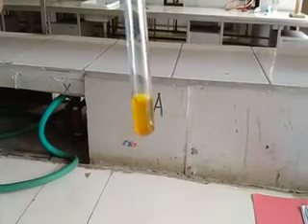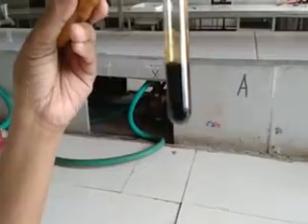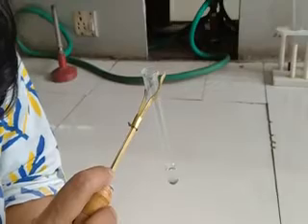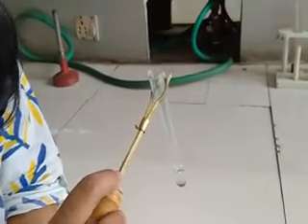Now we will do the test for alcoholic OH group. I have taken 1 ml of the organic sample solution and will add 1 ml of ceric ammonium nitrate solution. As you can see, no pink coloration has been formed, which confirms that the given organic sample does not contain an alcoholic OH group. As no elements were detected in the Lassaigne filtrate test, the tests for nitrogen-containing groups — that is, aromatic amine group and aromatic nitro group — have not been performed.